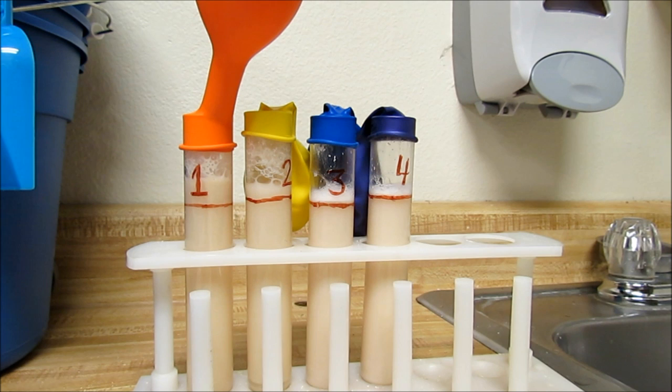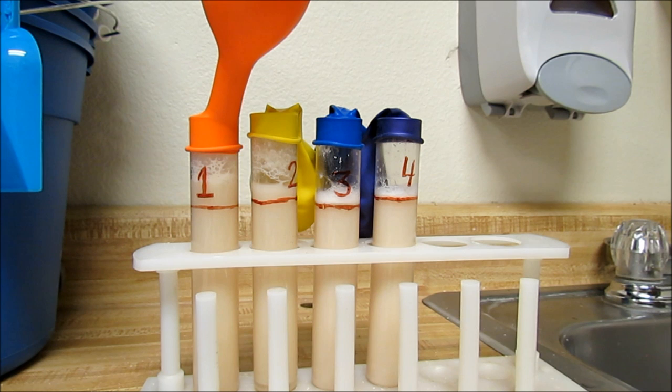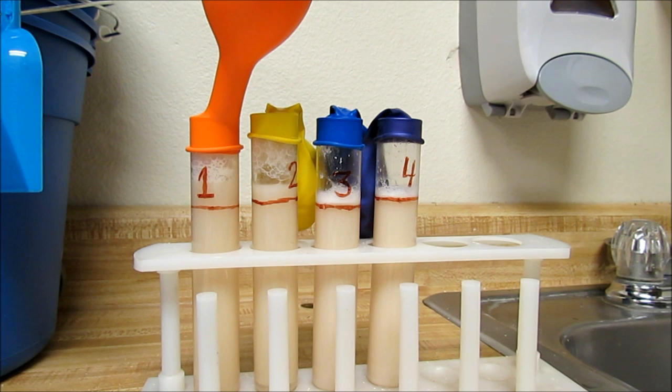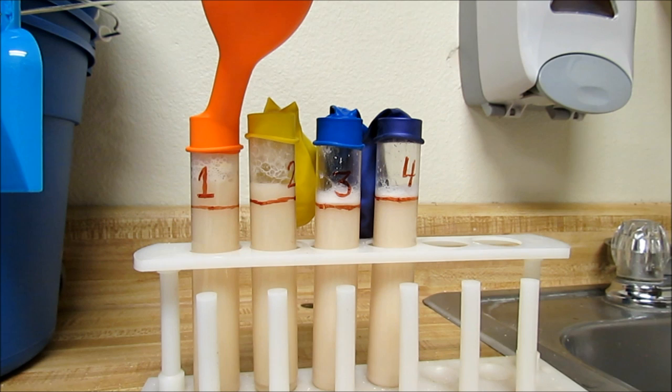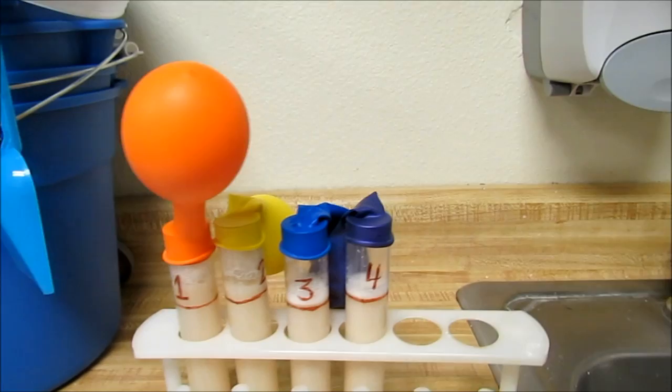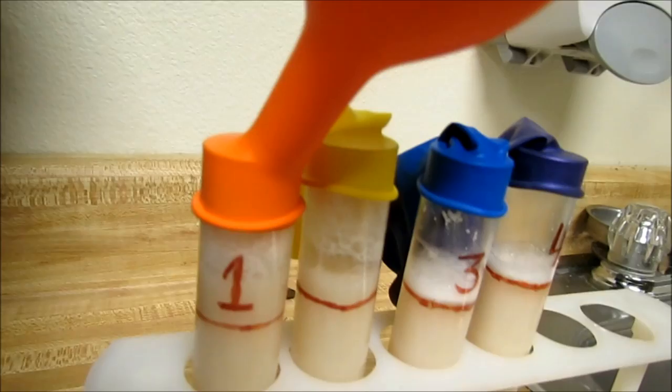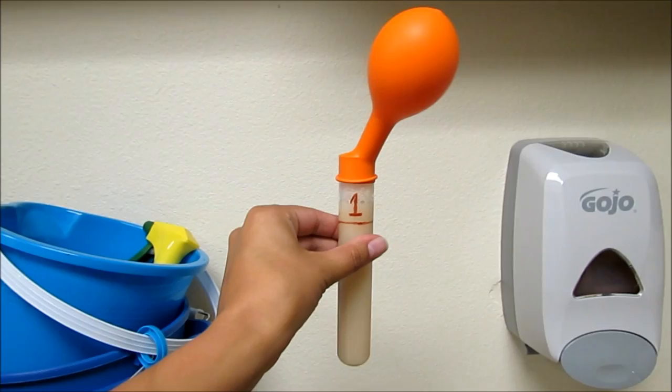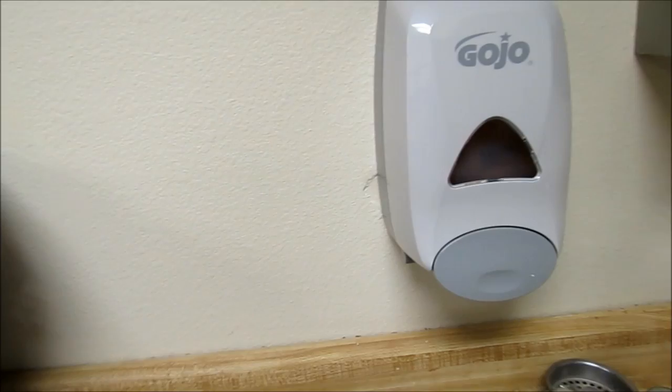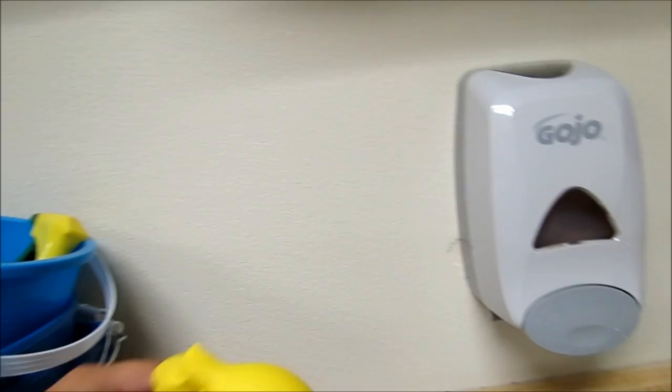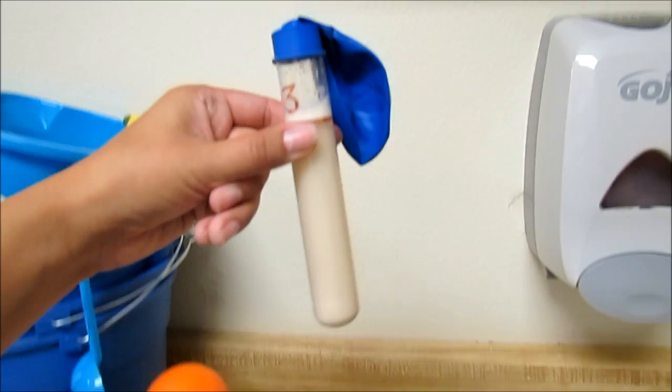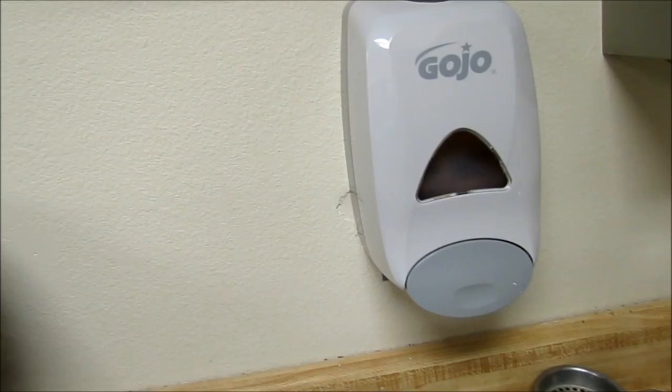Alright, we are just going to have one more data point in 25 minutes. Alright, so there you are for your last data point. Take a nice close look there. Number two. Number three. And finally, there is number four for you.